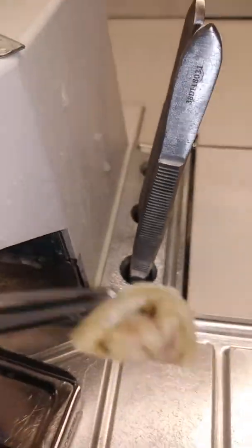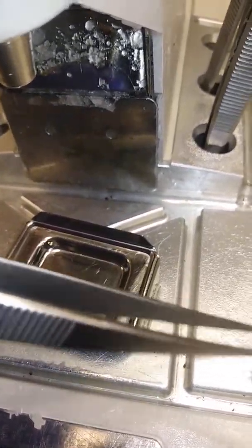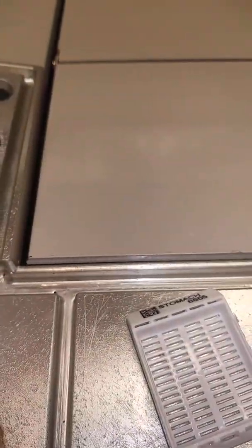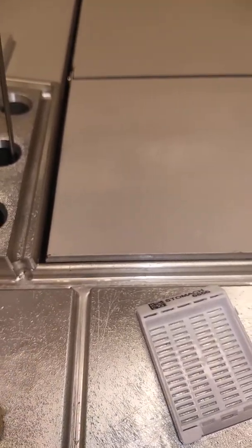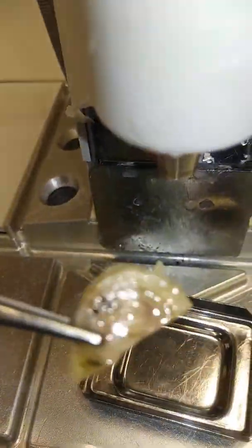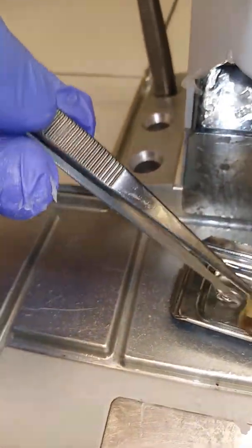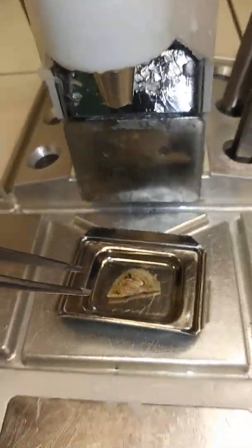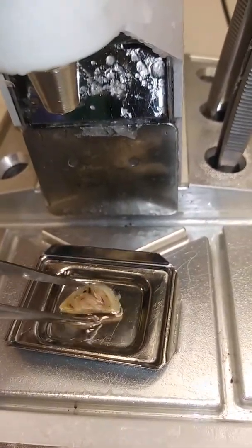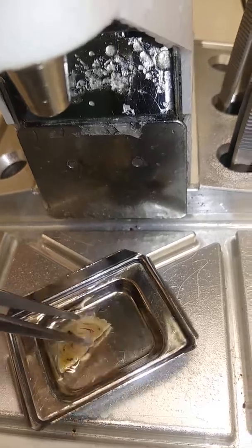You get the tissue and let's see which is the best side to embed this. You cannot embed it standing up — that's the wrong way. You see all the details on this, so that's how you have to embed it: flat like this. Seems like the other hand is the best way to embed it.